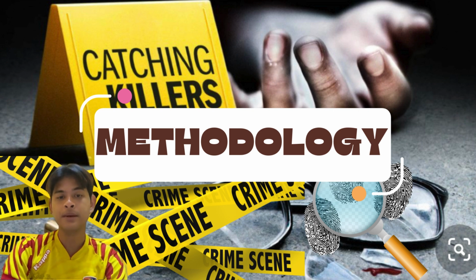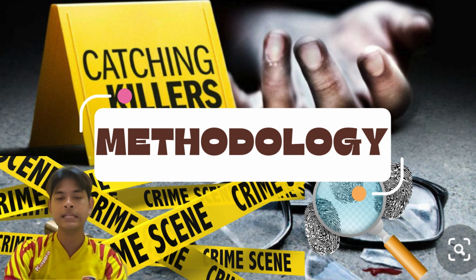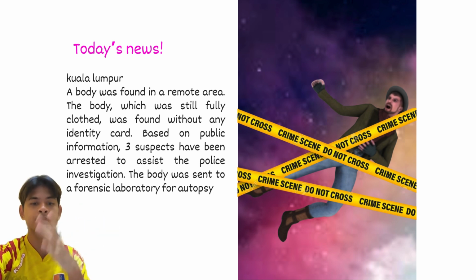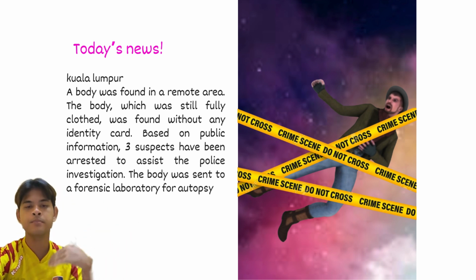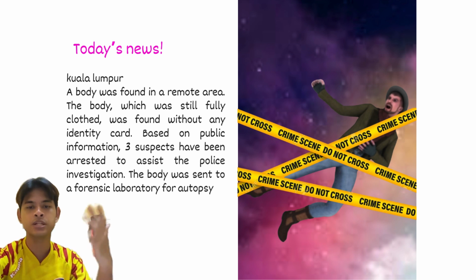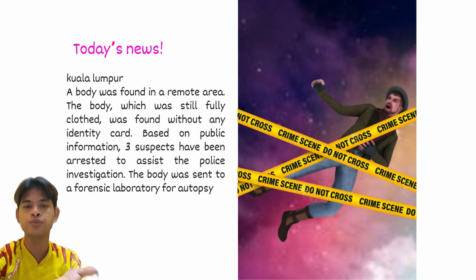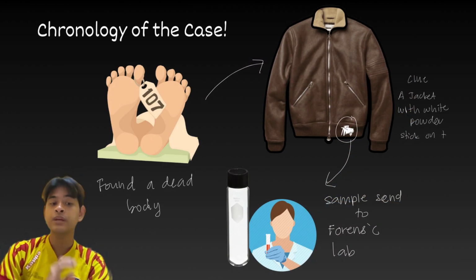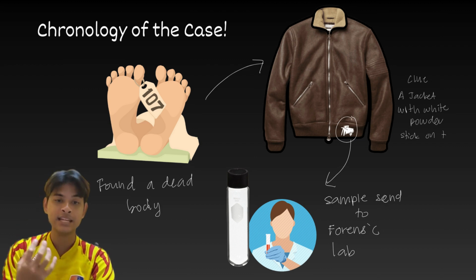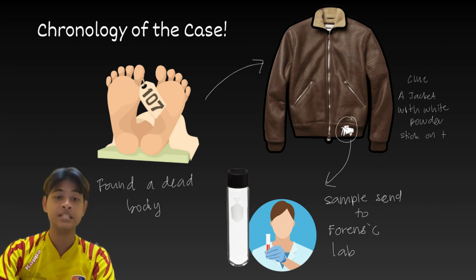So here is some of the methodology that we use in our kit. We start with crime cases that have been published in a newspaper. This gives a basic situation of what happened in the case that is proposed to the student. Then we give the chronology of the case, whereby they need to have a better understanding on how to solve the case that was told in the newspaper just now.